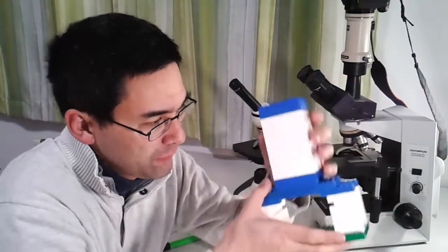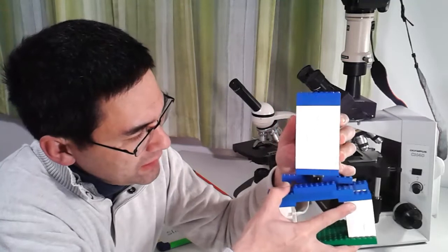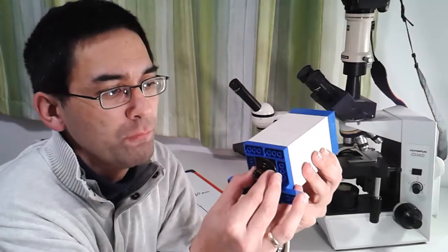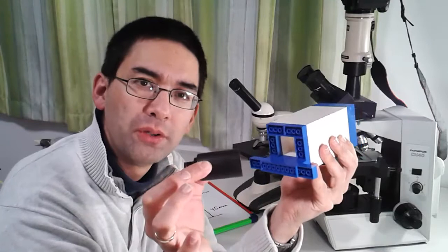So that is how I'm actually focusing, and it works fine. The actual main part here is the tube. Now for this I've got to take this apart. What you can see down here is the objective — this is a 4X objective. I mounted this objective also on a film canister.